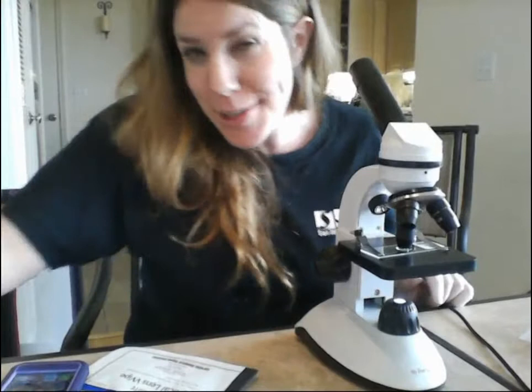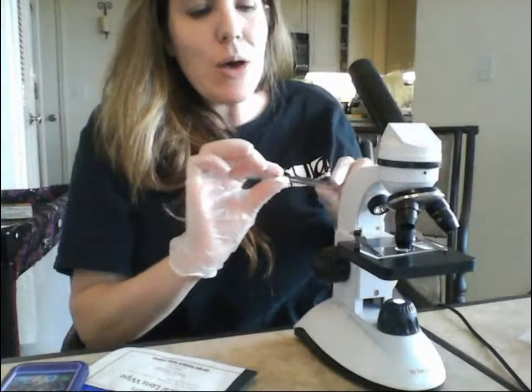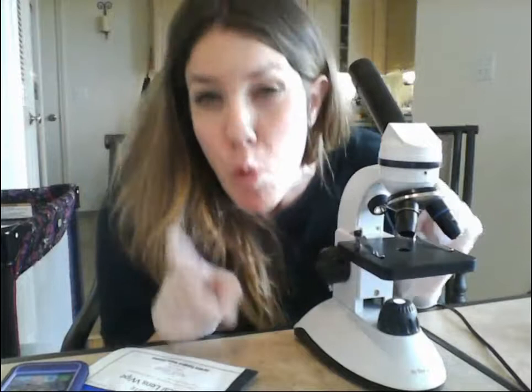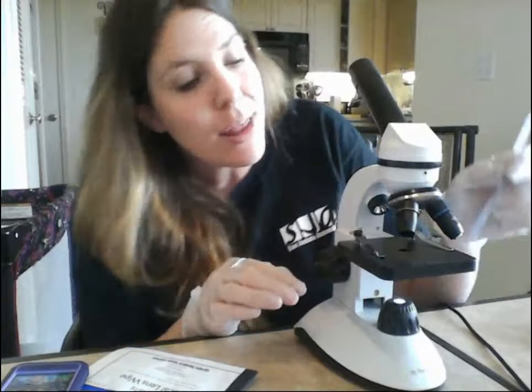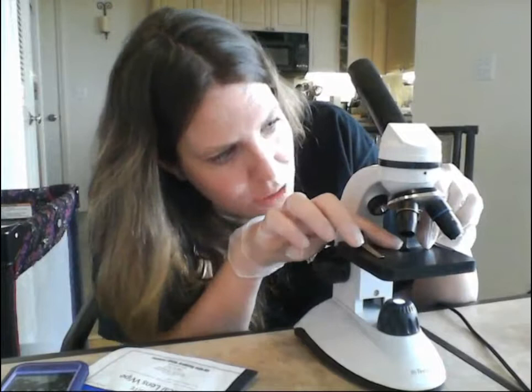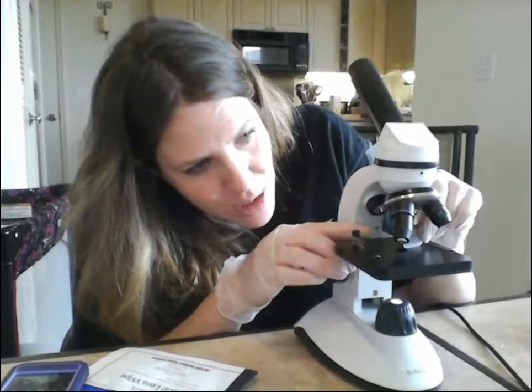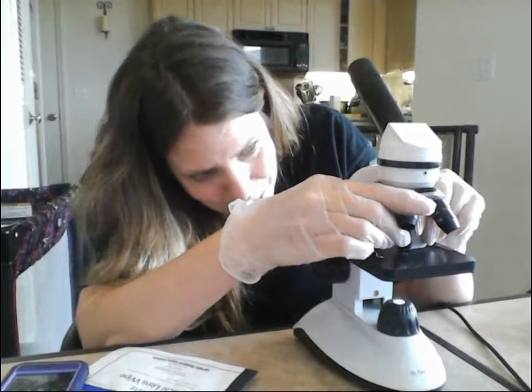There's something else you need to do here. Grab your 6-inch plastic ruler — we're going to use the metric side, the millimeter side. Switch back to the 4x, remove your slide, and measure the working distance between the specimen and the bottom of each objective lens. Just estimate the number of millimeters between the stage and the bottom of each objective — I'll let you measure it and record it into your handout. Switch to the next objective, measure that distance, then the next one — there won't be much distance on the 40x.